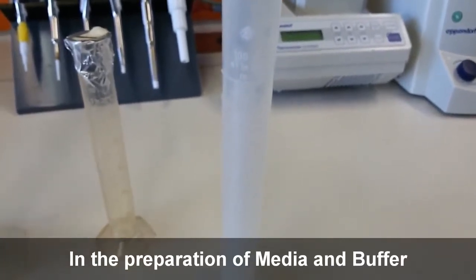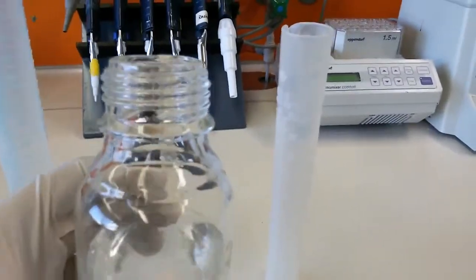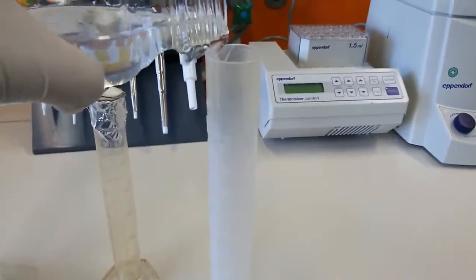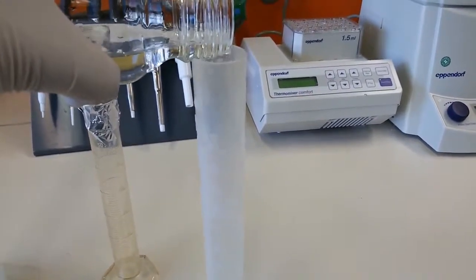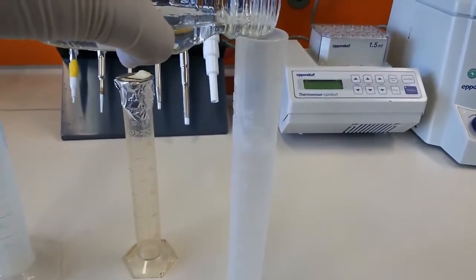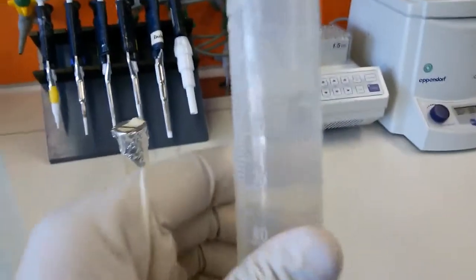We'll take the example of our 100 ml measuring cylinder, and we will measure some volume. Right now I have some water in my hand, and I will show you in a very general way how we measure it. Now it's filling up. Let's say you just want to measure only 90 ml. So you fill it like this. Then you can look here.